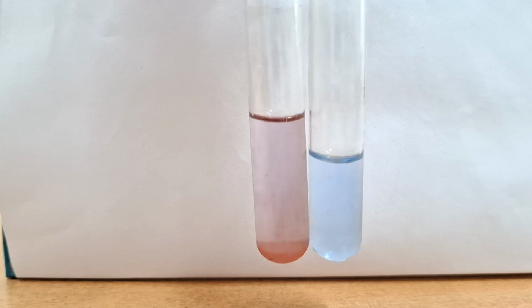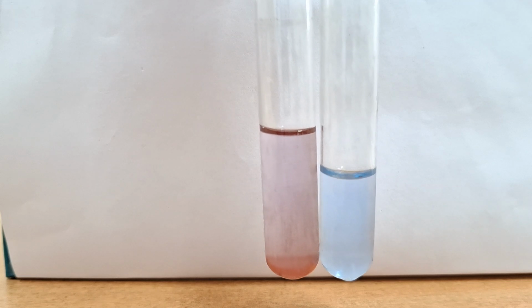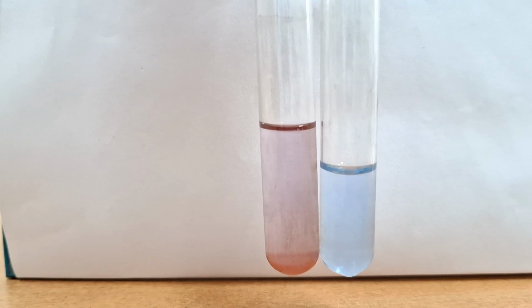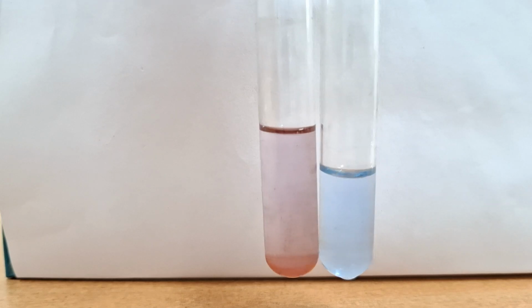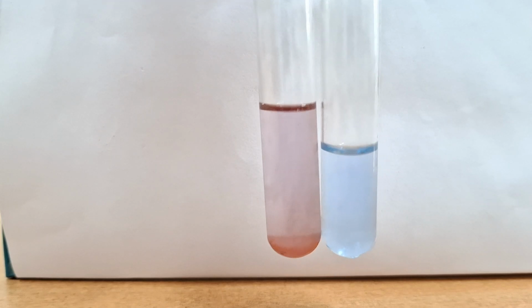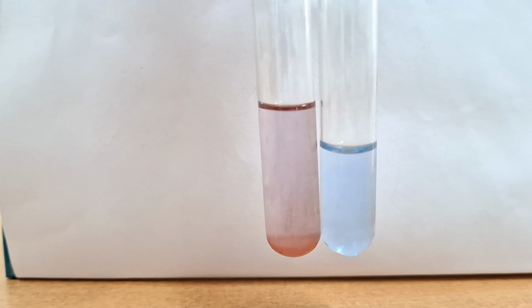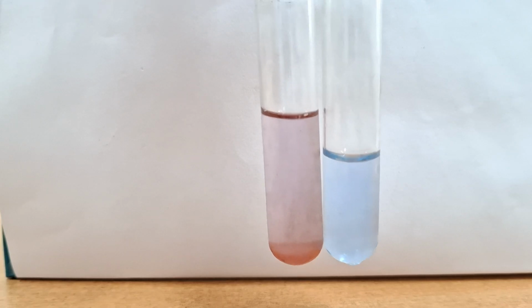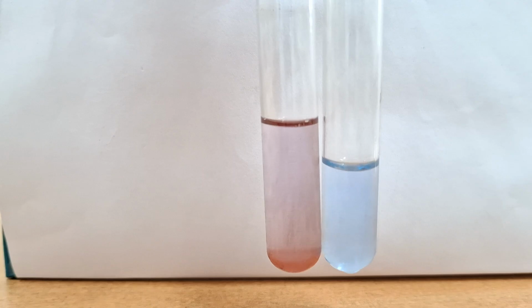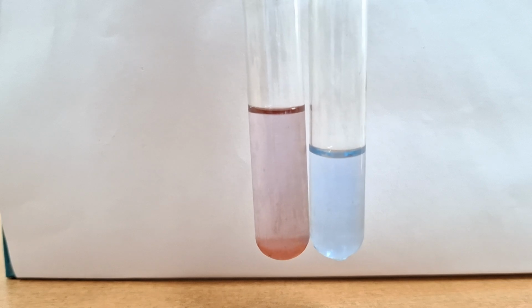And what is the principle of the biuret test? Why is the purple color developed? This develops because of the formation of a copper coordination complex between cupric hydroxide and the peptide linkages of protein. That's why it will yield a purple color. So this reaction is due to the presence of peptide linkages. Hence all proteins will show this reaction as positive. Okay. Color intensity will depend upon the number of peptide linkages. A darker color is proportionate to a greater number of peptide linkages.